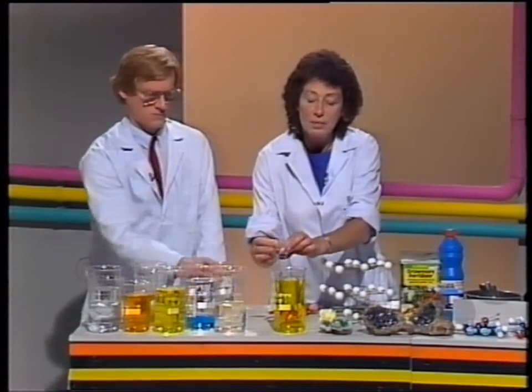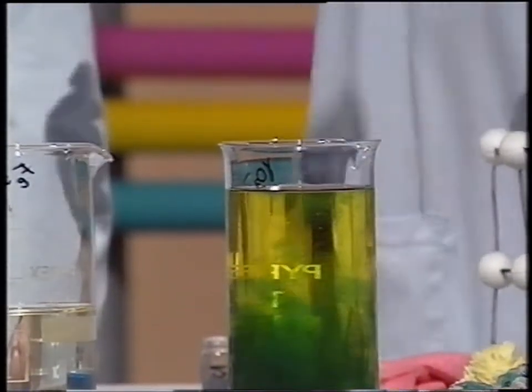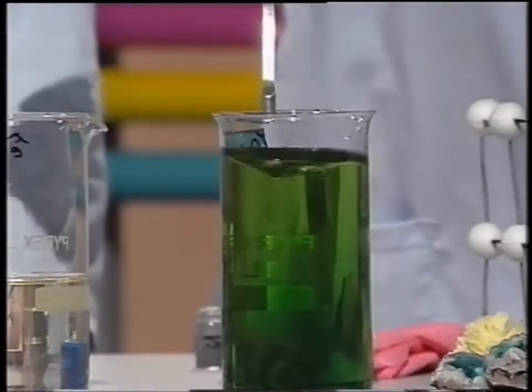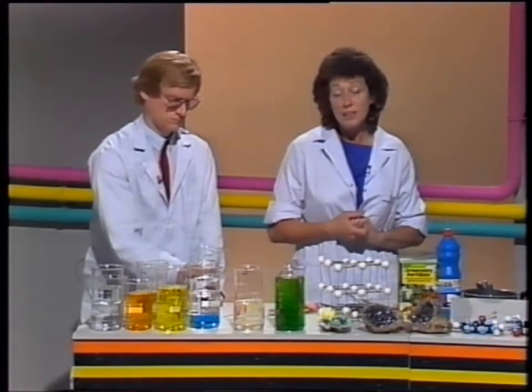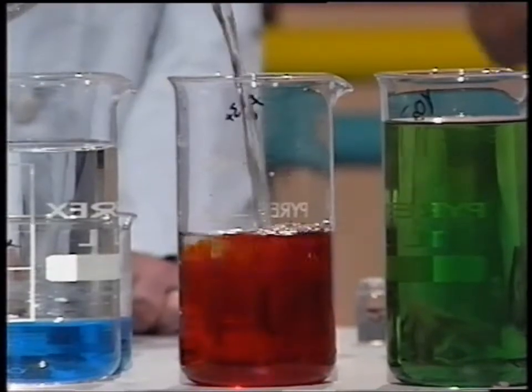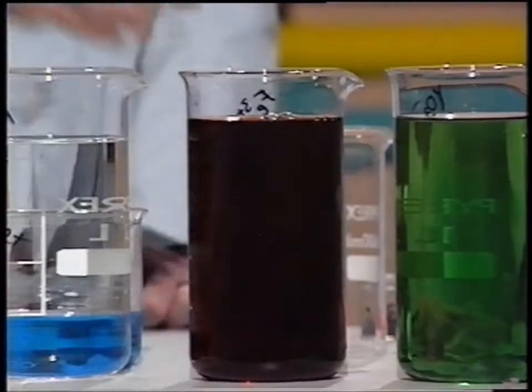This yellow vanadium and zinc does something called a redox reaction. And you can see the yellow colour is already turning green. If you watch it, it will end up blue and possibly even purple. The iron can form a complex with this thiocyanate, which is very like the red hemoglobin in your blood in some ways, and hence the similarity in the colour.